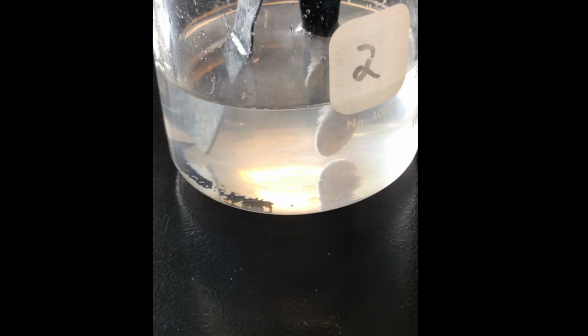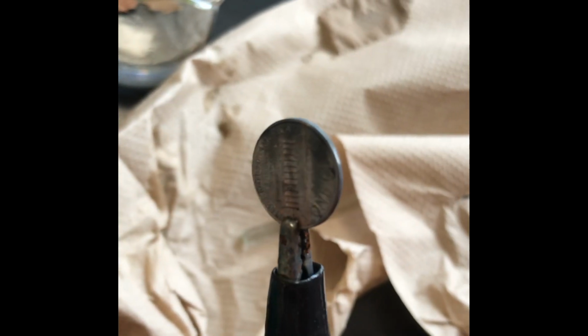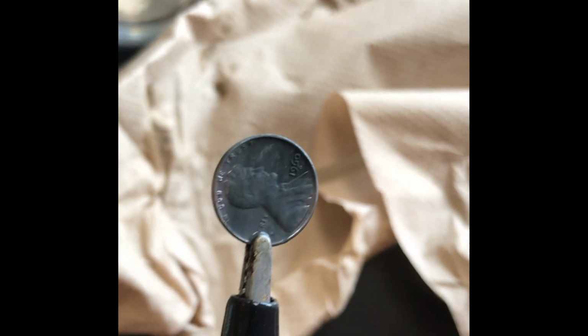This mass was 3.097 grams, which demonstrated that the mass increased from the initial mass of the penny. The change in mass of the penny was only 0.006 grams, which is much smaller than a real electrolytic cell performed under better conditions would have electroplated. Errors in our electrolytic cell that could have lowered its efficiency include an inaccurate measure of the mass, an inconsistent current applied, and the oxidation and reduction of other substances that weren't supposed to be part of the reaction.